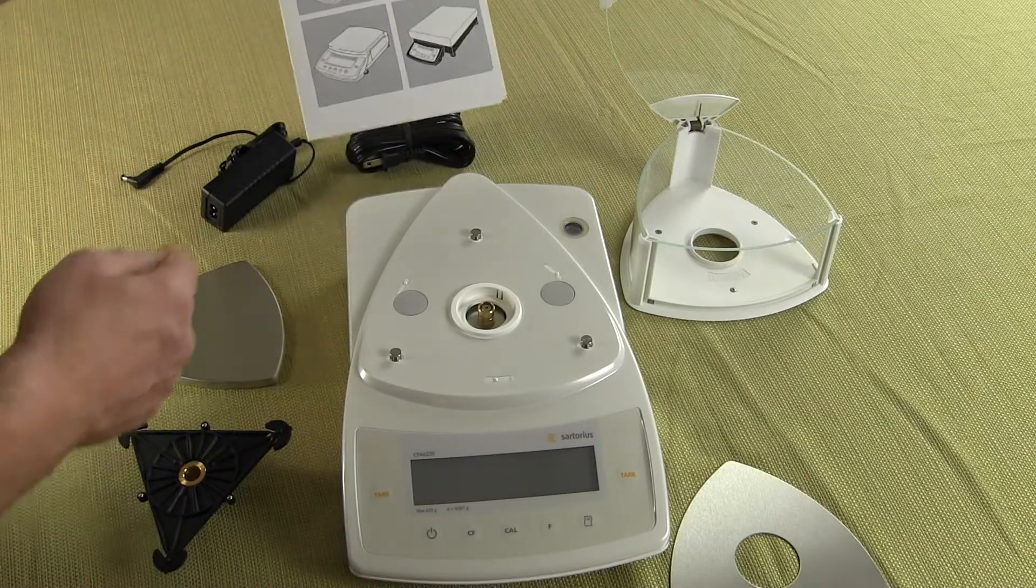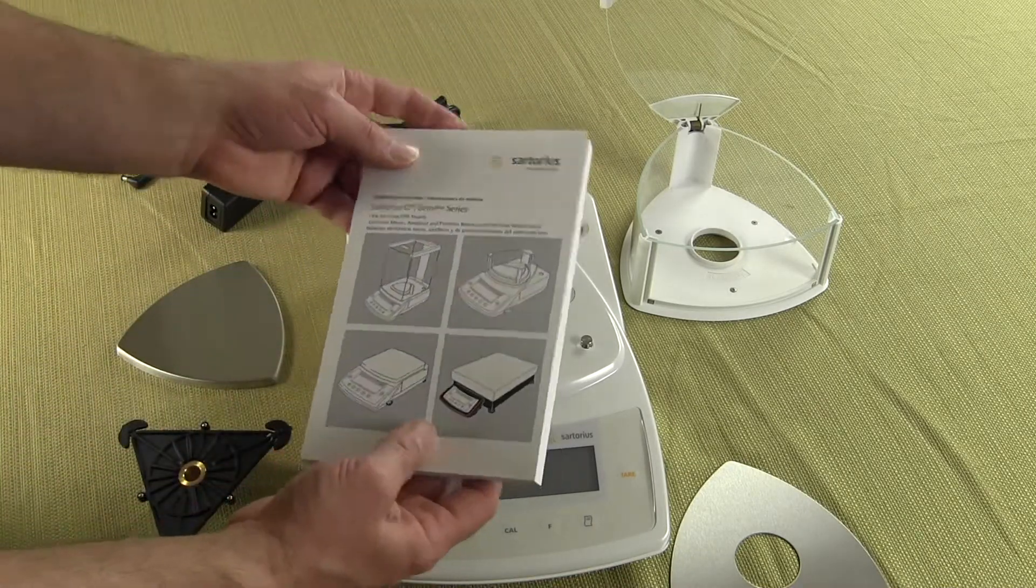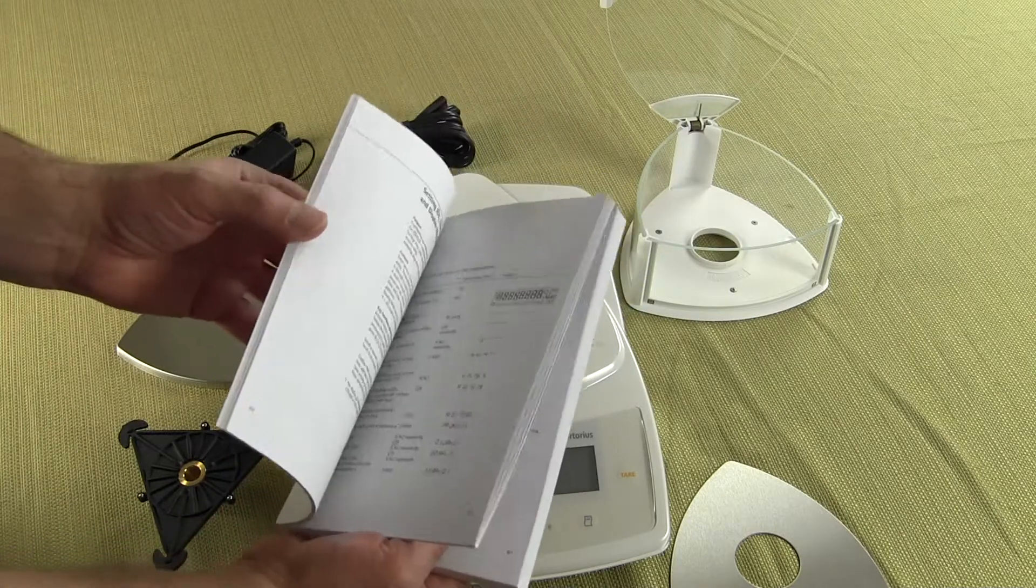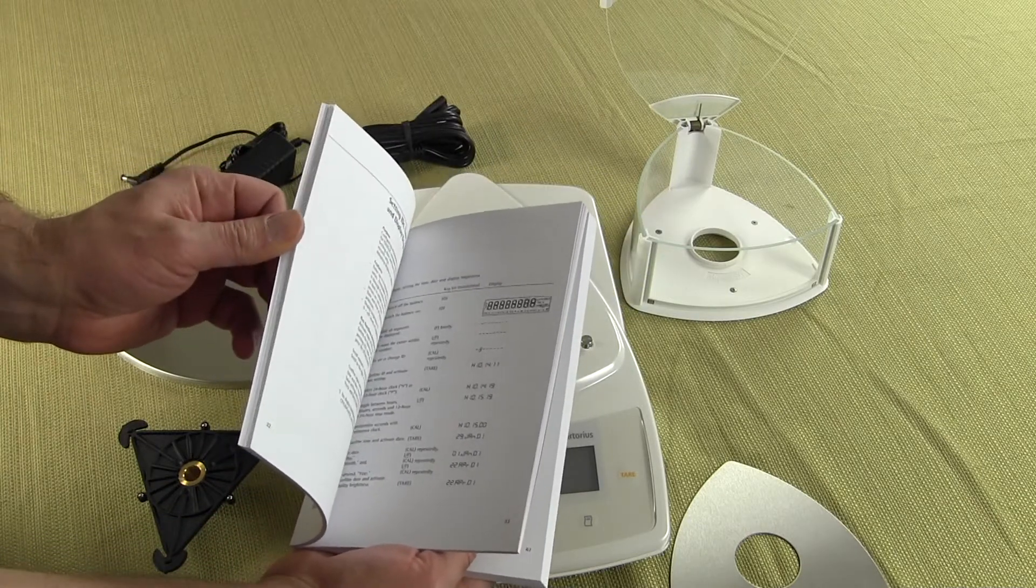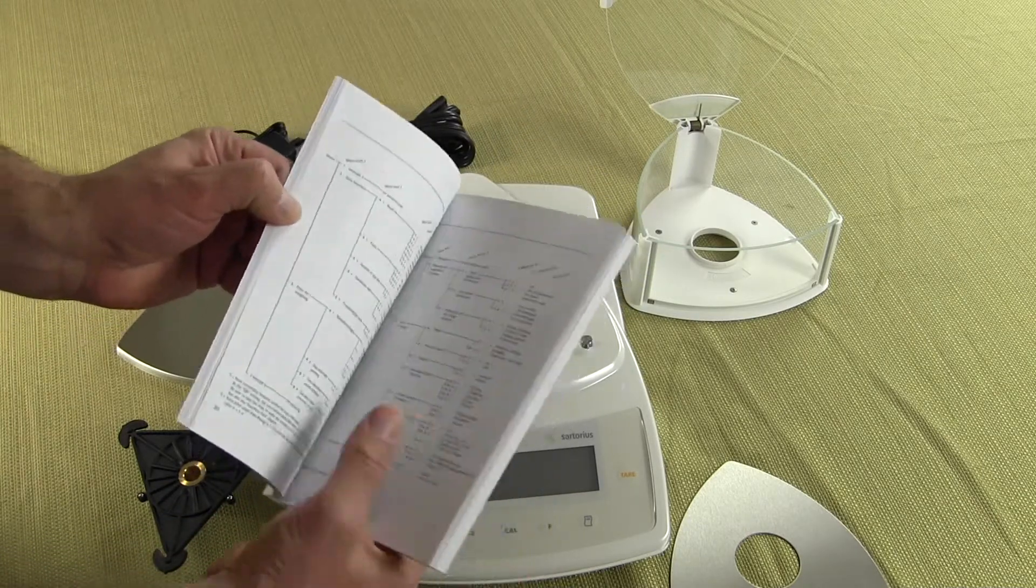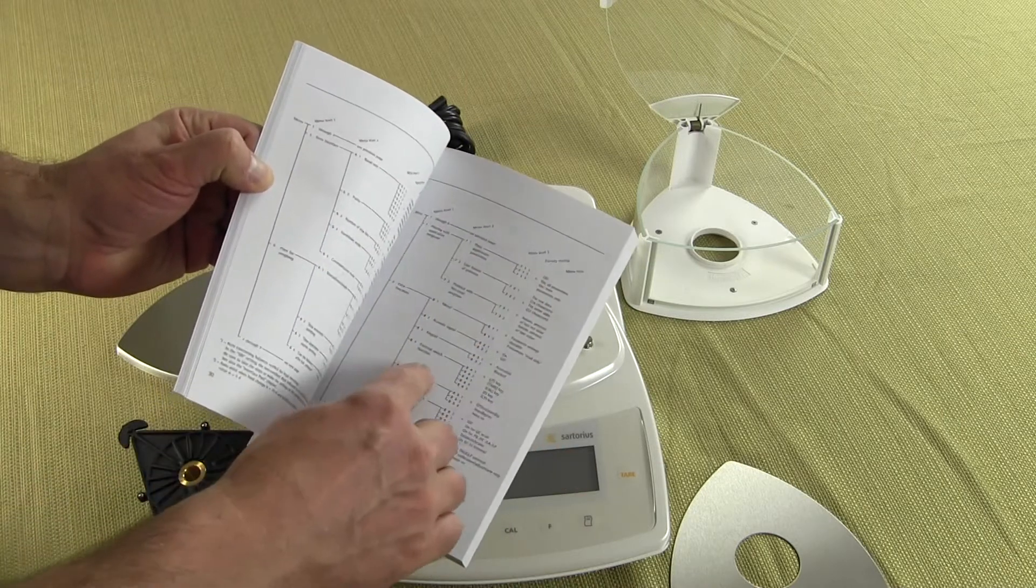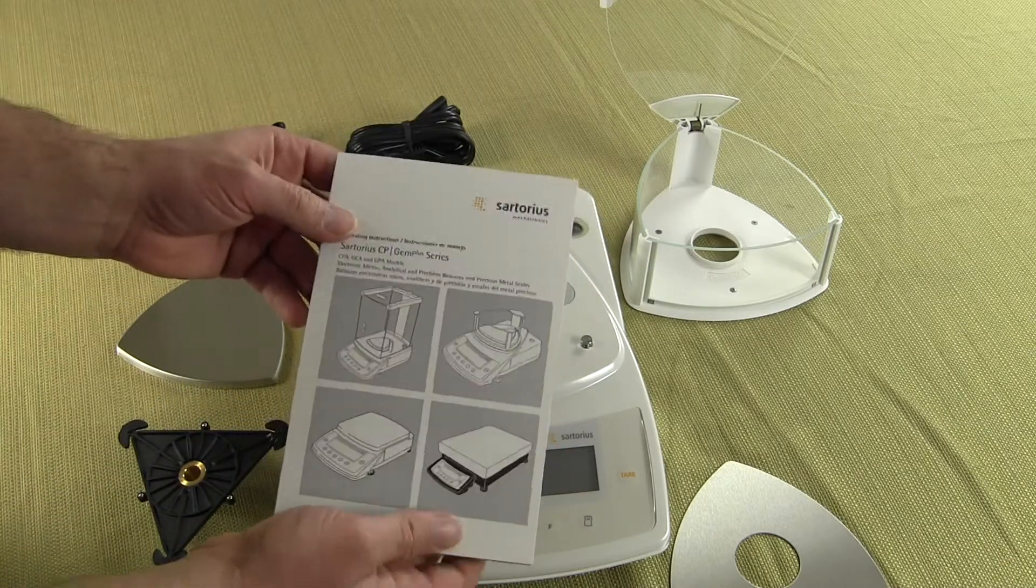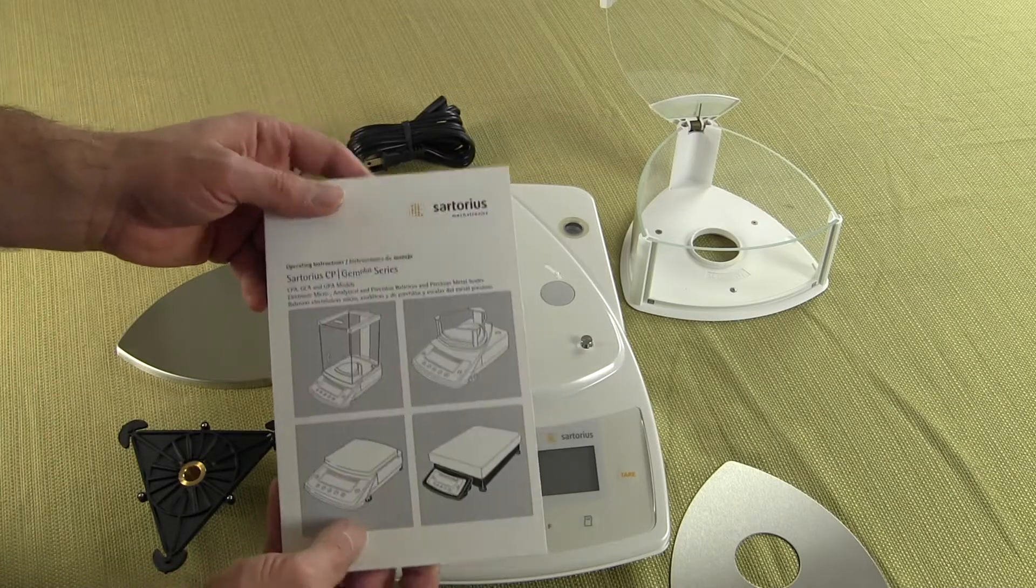We also have a manual, it comes with a manual and inside it's fully detailed telling you how to set up the balance, all the balance configuration. These are all the configuration codes, so Sartorius does a great job in the manual.